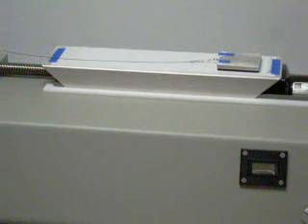The measurement of static coefficient of friction is highly dependent on the rate of loading and on the amount of blocking occurring between the loaded sled and the platform due to variation in time before motion is initiated. Therefore, a uniform operating procedure should be established and adhered to. Place the sled lightly and gently on the plane to prevent any unnatural bond from developing. A high starting COF may be caused by undue pressure on the sled when mounting it to the plane.